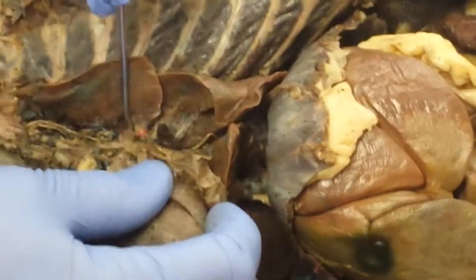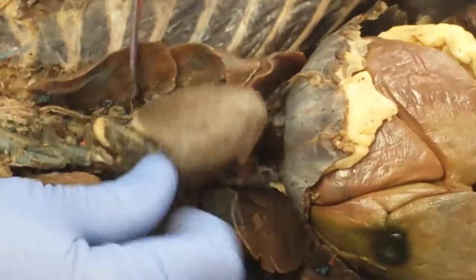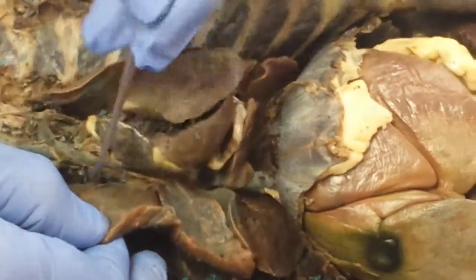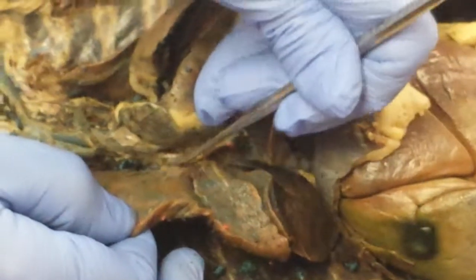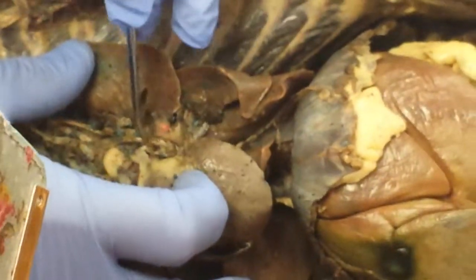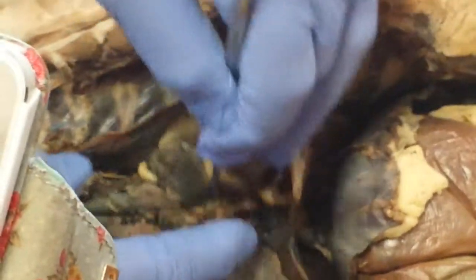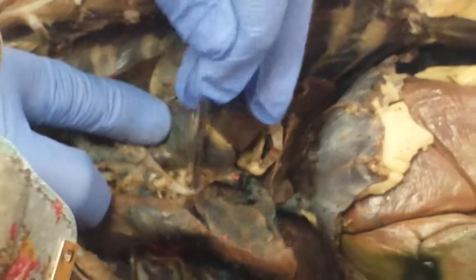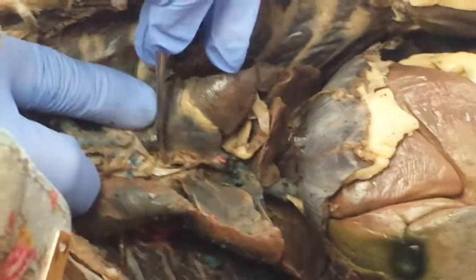But note that you have a splitting of the pulmonary trunk here. So you have the left pulmonary artery here. This is the hilum of the lungs right here, on this little indentation area where the bronchi, arteries and veins enter and so forth. That's called the hilum, as is this area right here. So over here, we have our left pulmonary artery. We roll this way. We might be able to see in this region, somewhere right in here, should be the right pulmonary artery.